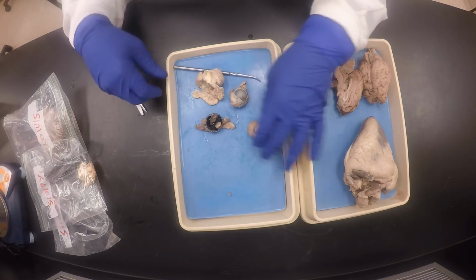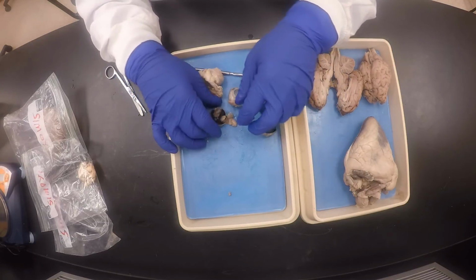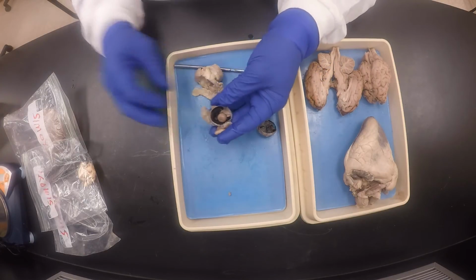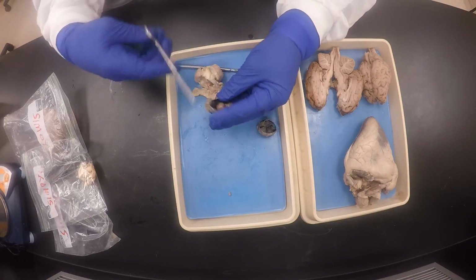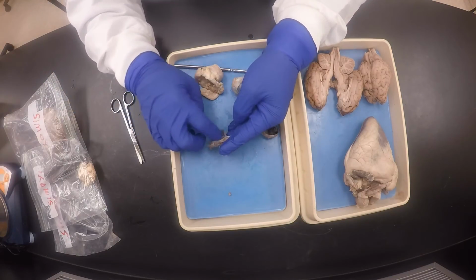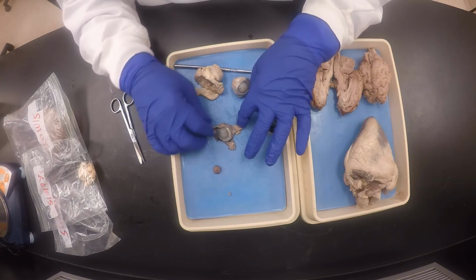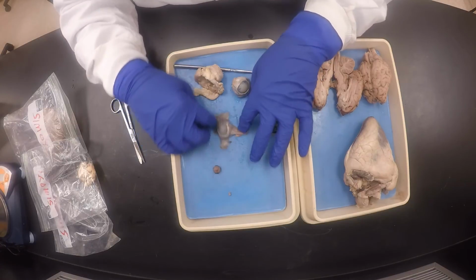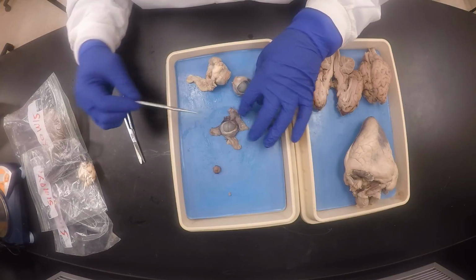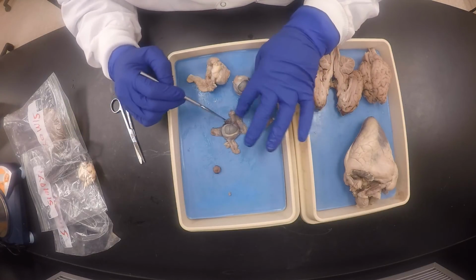So I can see that there's a retractor bulbi. You can see the optic disc. And then there is the lens. I'm just recording for you guys so you can see. There is the lens. That's how it will appear in the exam. So I have to hold my eye properly. So again, to do the extrinsic eye muscles, the eye will be like that in the exam.